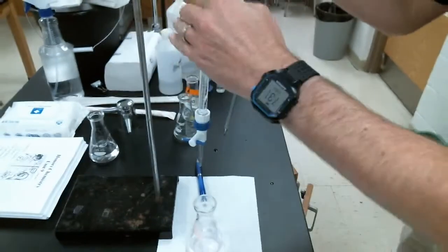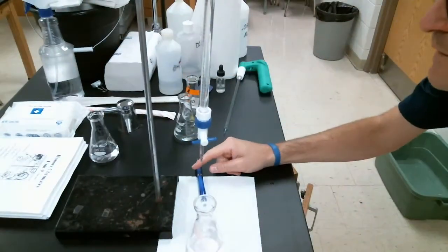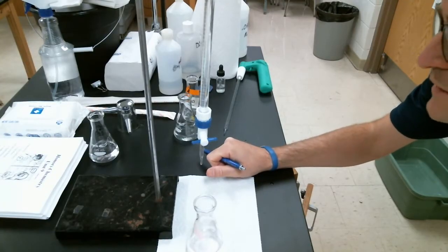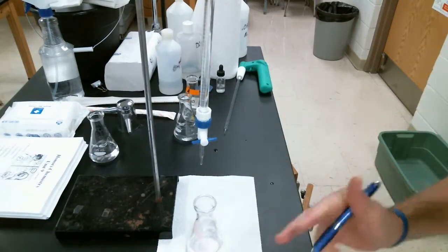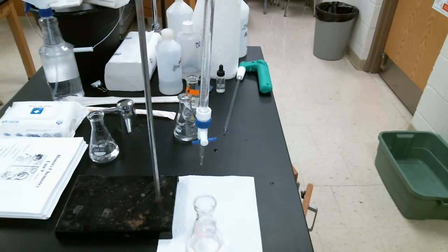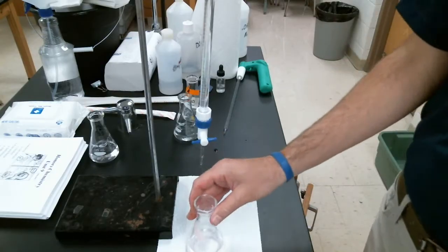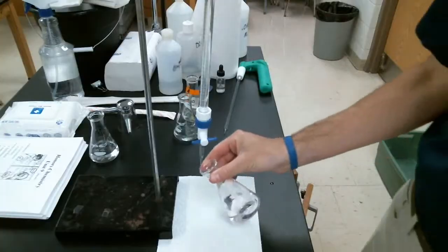I think that final volume would be, I was a little bit off, maybe 35.20 milliliters for that final volume. Now I could subtract those two, 35.20 minus 16.80, to get the volume of titrant used. Again, notice the real light pink here.